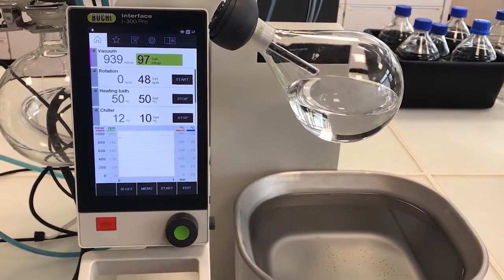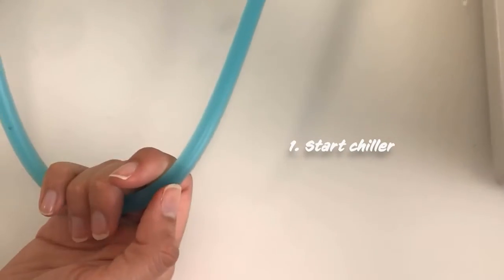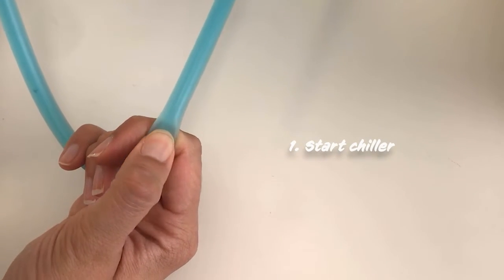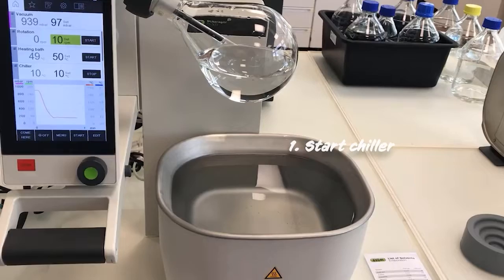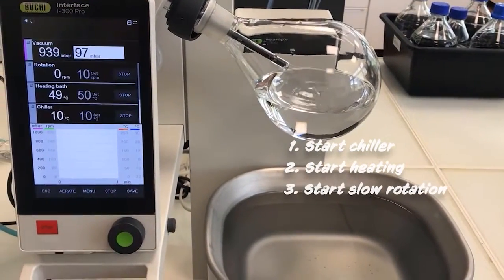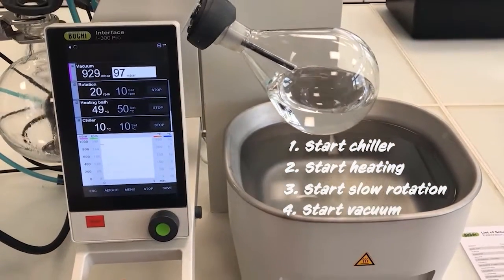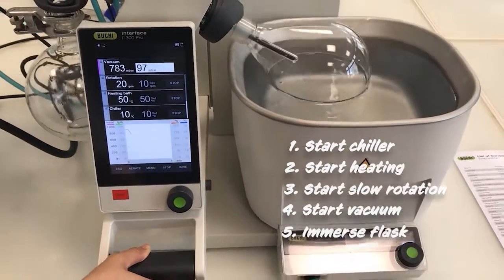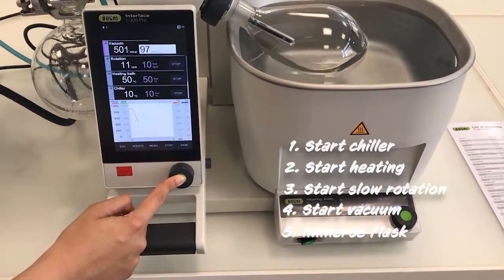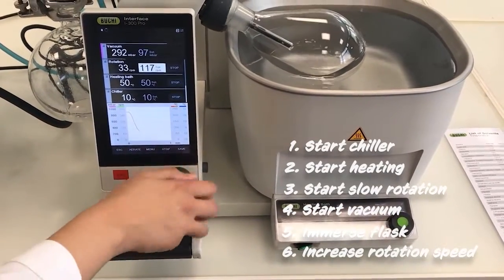Now it's time to start the distillation. Firstly, we start the chiller and check if the coolant is flowing by shortly squeezing the cooling tube. If you can feel a short pulse, it means the coolant is running. Secondly, we start the heating and then we start the rotation slowly. Then we press start for the vacuum pump and submerge the flask deeply into the heating medium. Once this is done, we can increase the rotation speed to 280 rpm, which is the optimal rotation speed.